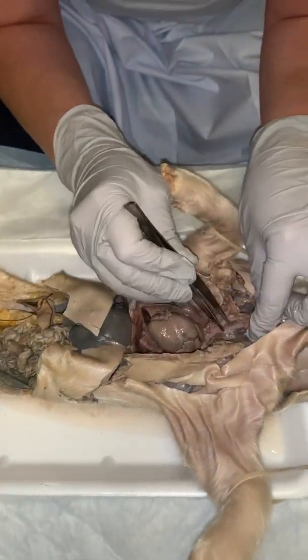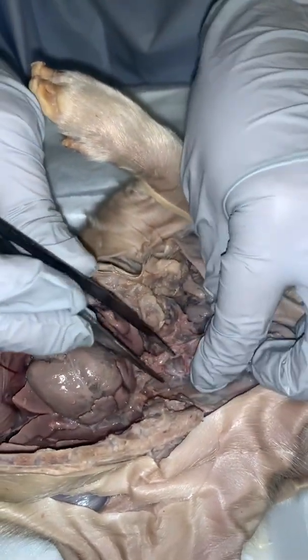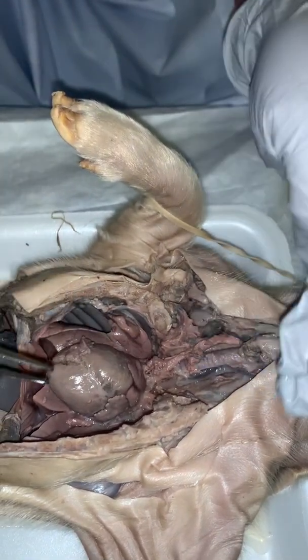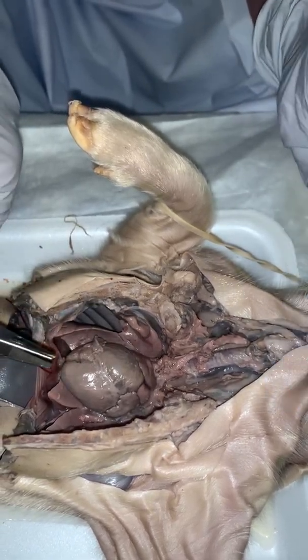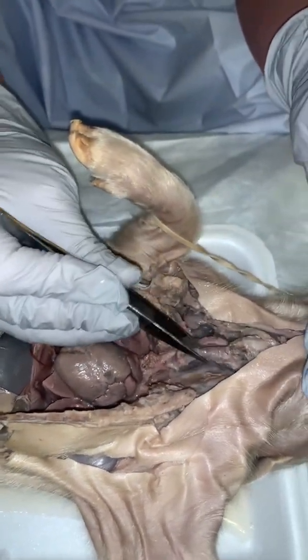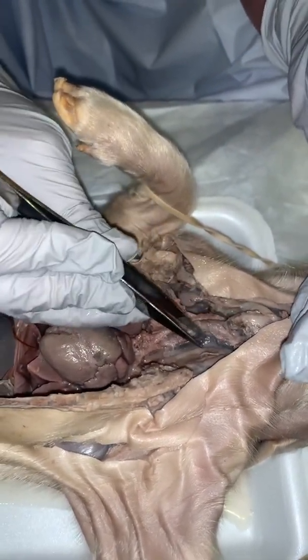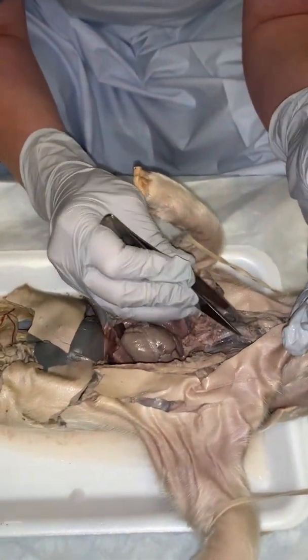Also, to back up here to the windpipe, we have an epiglottis. It's a flap of tissue. And when we swallow, the larynx moves up, and the epiglottis is going to meet the larynx and move down, and it's going to close off our airway so that when we swallow, it doesn't enter into the airway. It goes into the esophagus instead. So that's the job of that epiglottis flap.